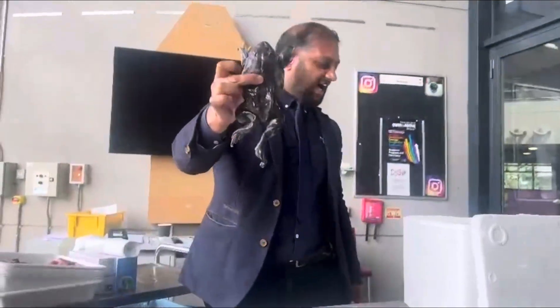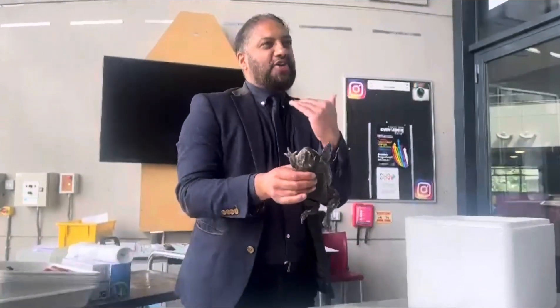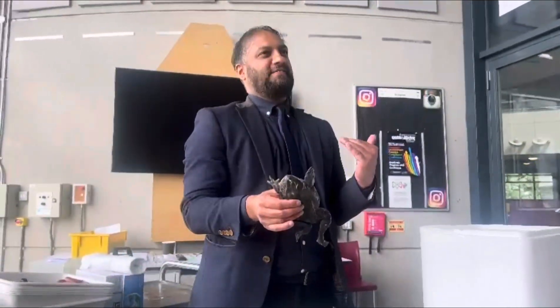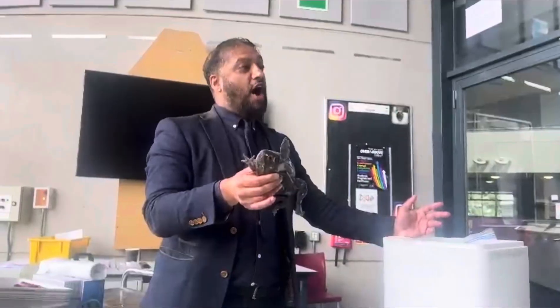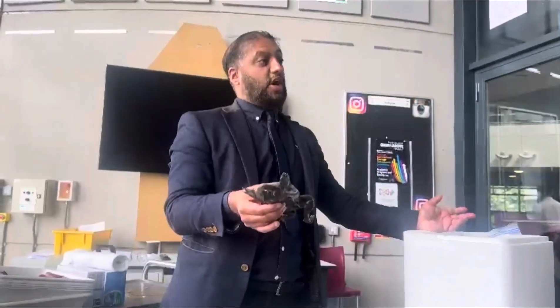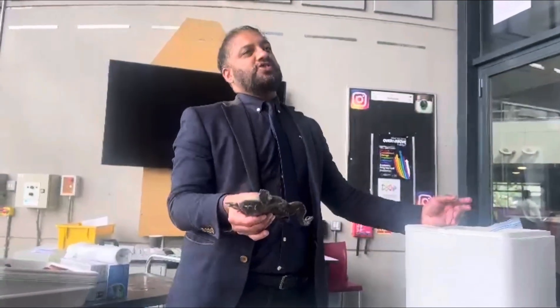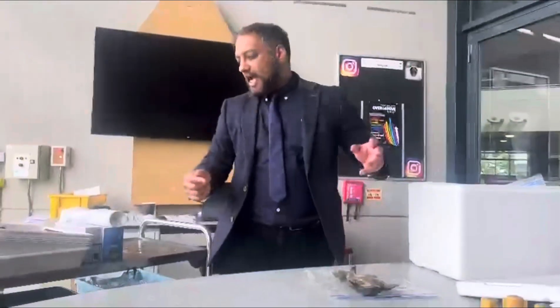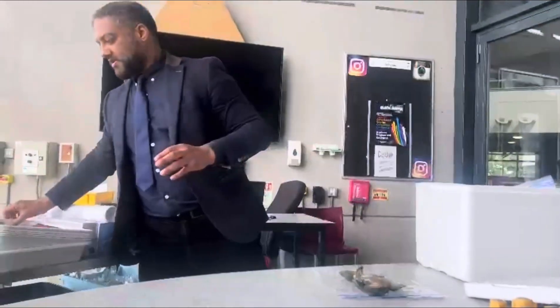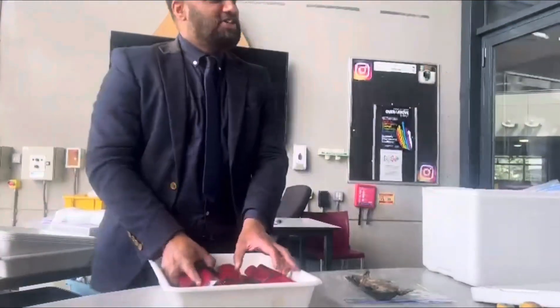You are going to be dissecting this. The deal is, you are not allowed to mess around. I was out of school last week and they had some frogs left over because I had been dissecting them all last week anyway. So they had some leftovers and I said I might just take them. Now how are you going to dissect this? You are absolutely right — be respectful, you are absolutely right. So my bad.